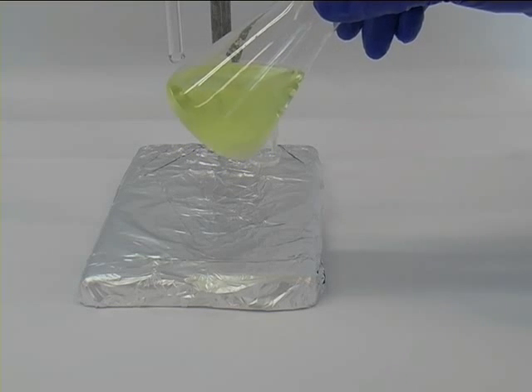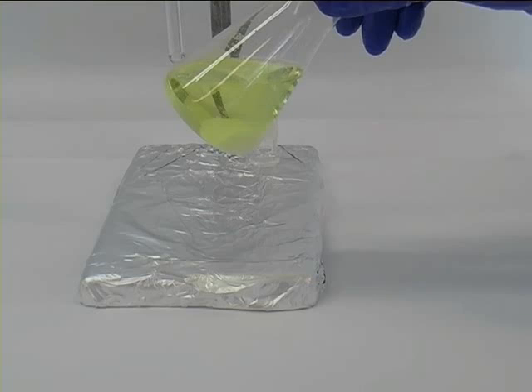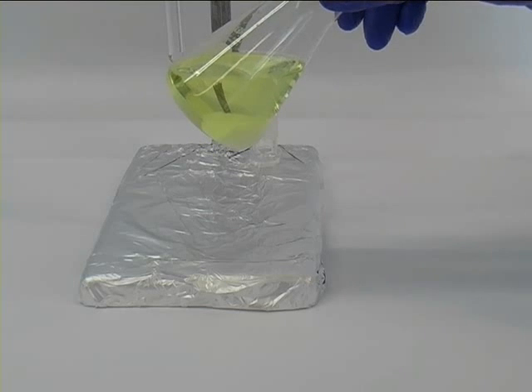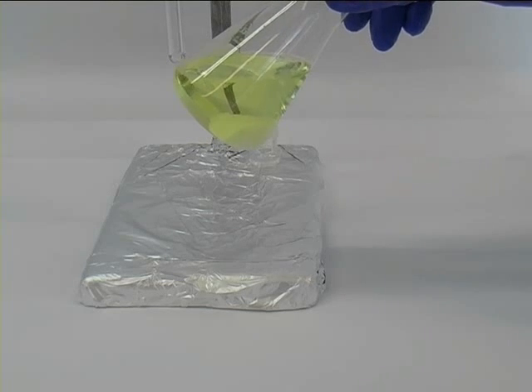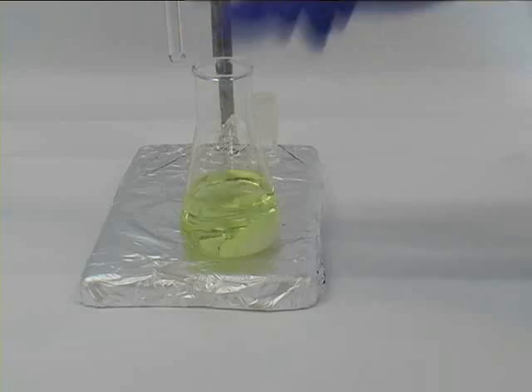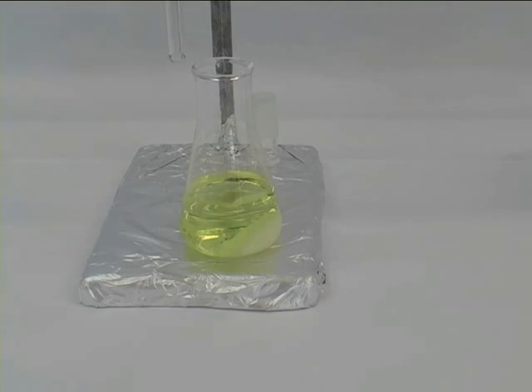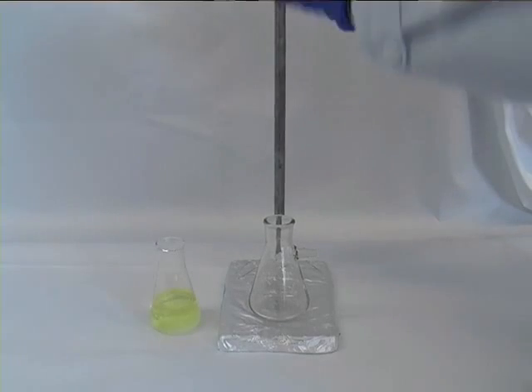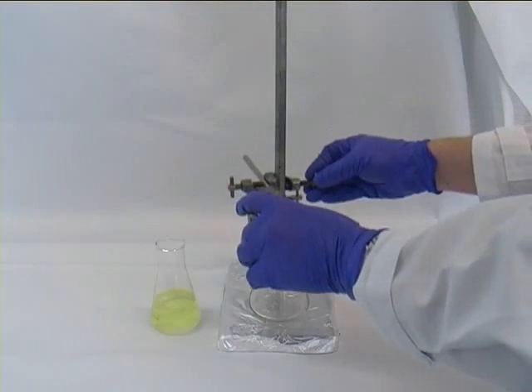However, if you have a flaky suspension of magnesium sulphate as in this example, you have effectively dried your solution and all that remains is to separate the solid from the liquid which is achieved by a standard filtration.